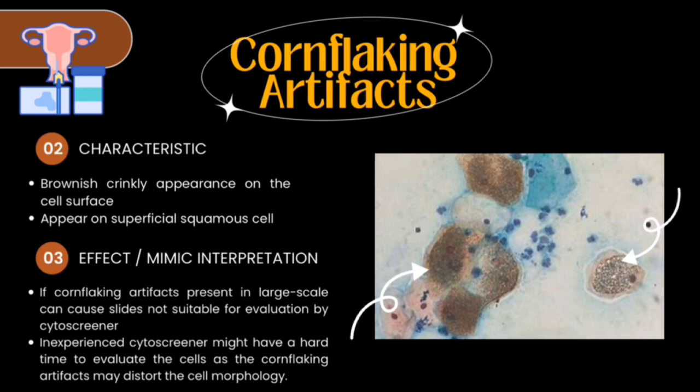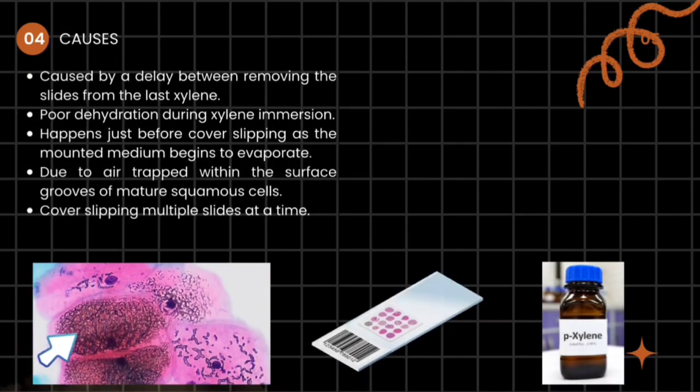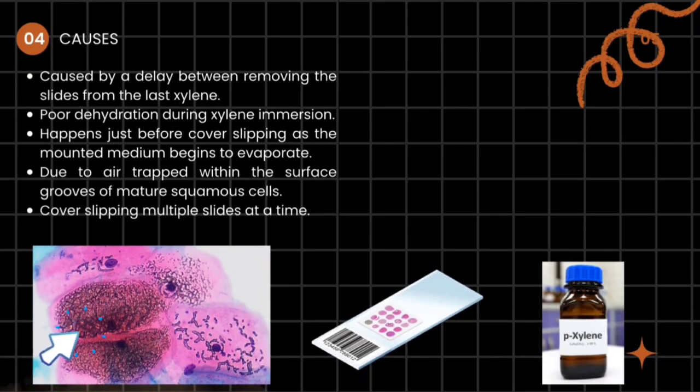The effect of this artifact is that if it is present on a large scale, it can cause slides to be not suitable for evaluation by the cytoscreener, and an inexperienced cytoscreener might have a hard time evaluating the cells, as the cornflaking artifact may distort the cell morphology.